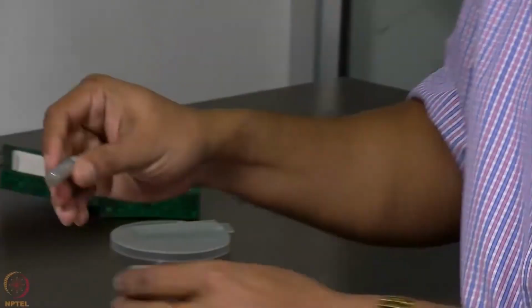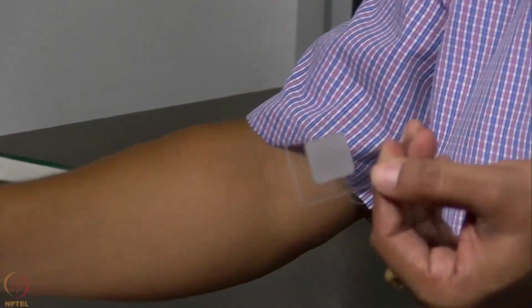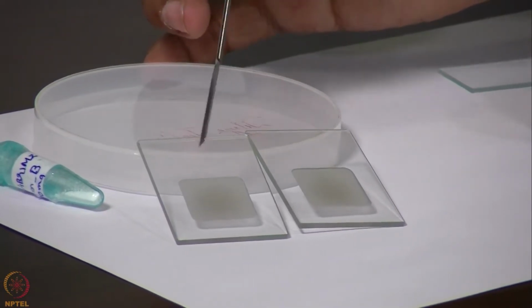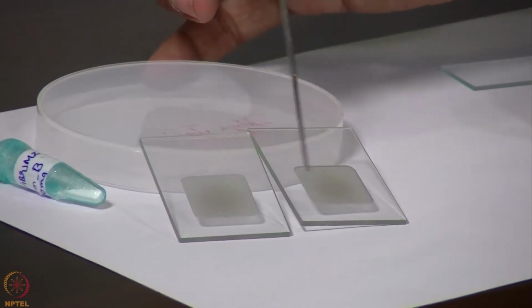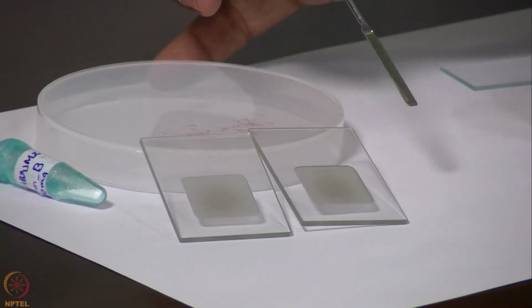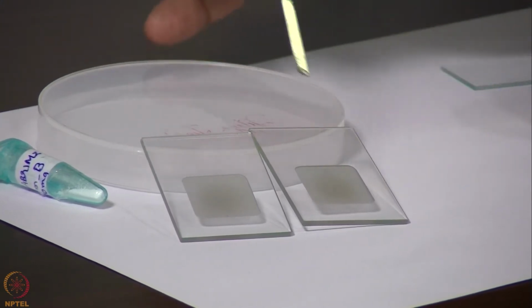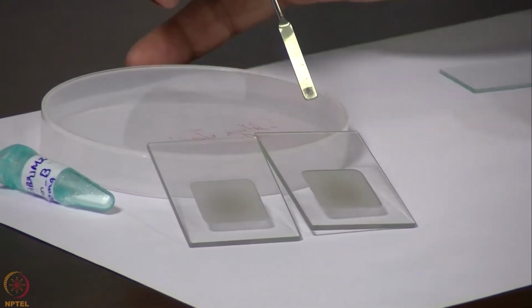Once we have powdered a sample using this mortar and pestle, we need to transfer it to these sample plates. These are the sample plates on which we need to spread our samples. You can see that the central region in these plates is etched, and these etched plates have different depths. Depending on the amount of sample that we have, we should choose a particular sample plate so that we fill the entire groove here with our sample.